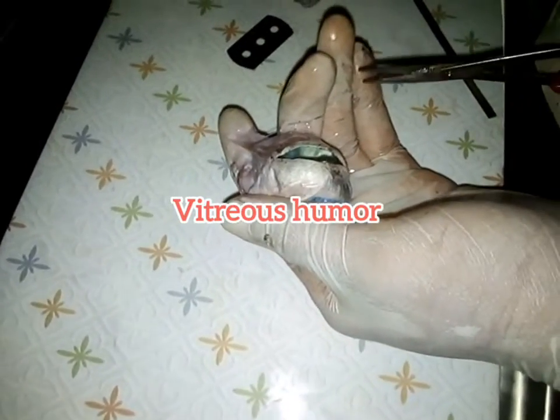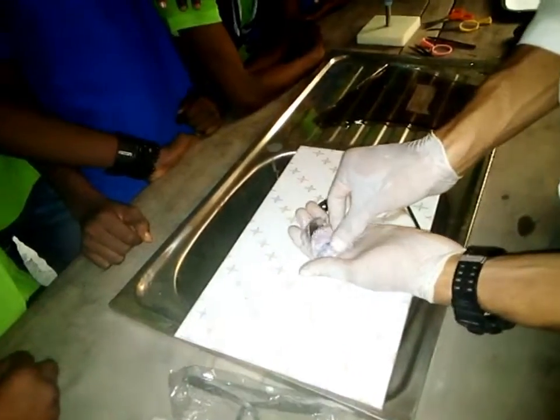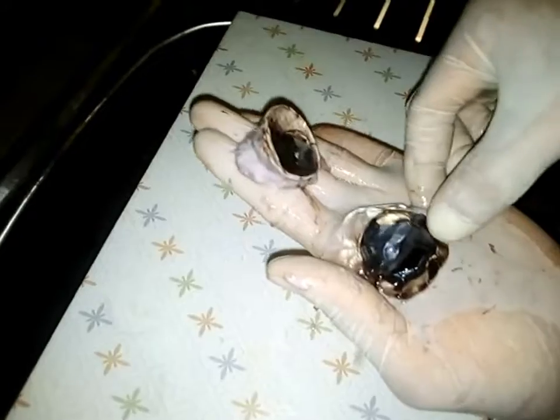You see there, it was made with what? With a kind of sphere, a glass-like container, something like that. Pure white.